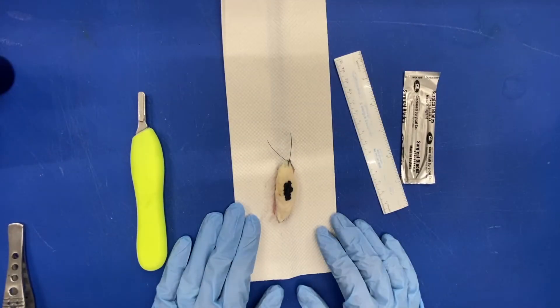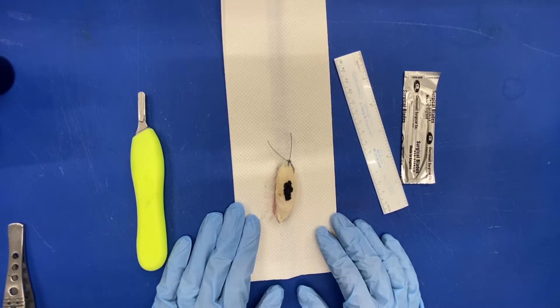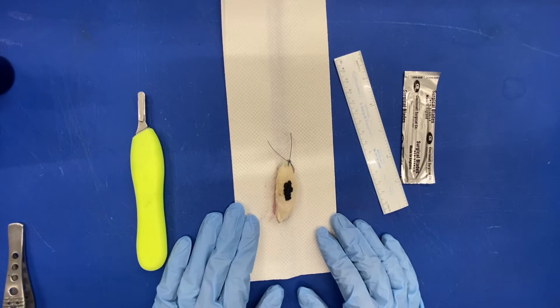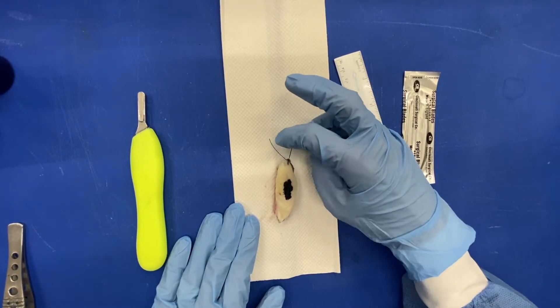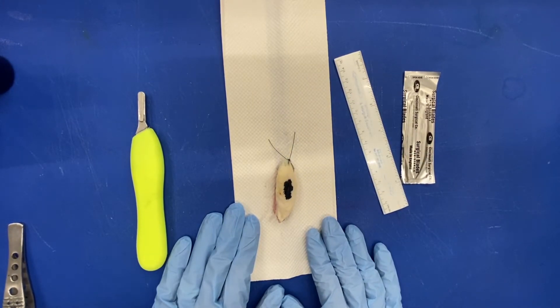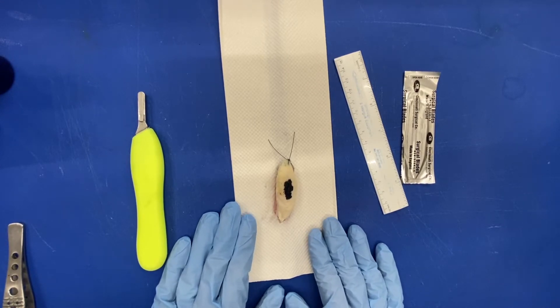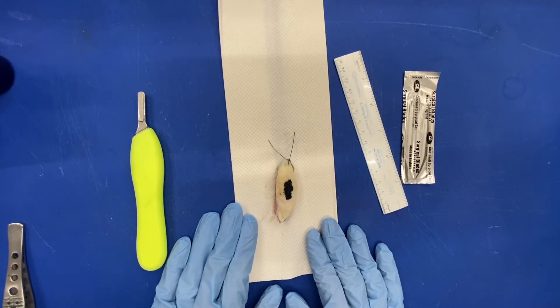Hello, my name is Roseanne Vitale and today I will be covering the gross section of an oriented skin ellipse. What you see here is an oriented skin ellipse that I have created using pig skin. On the superior aspect of the specimen here is a stitch which I will be calling my orientation. When receiving an oriented specimen you need to check the requisition form and confirm that the orientation you see on the specimen makes sense and correlates with what's in the clinical notes for the patient.